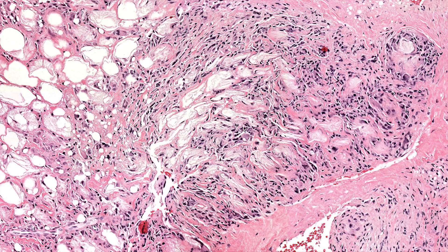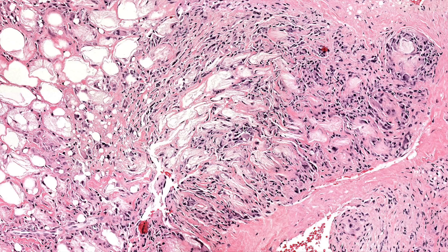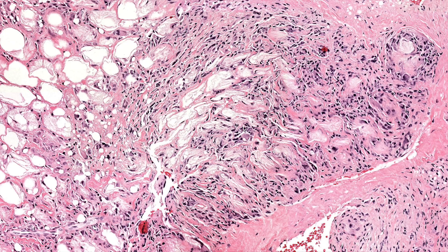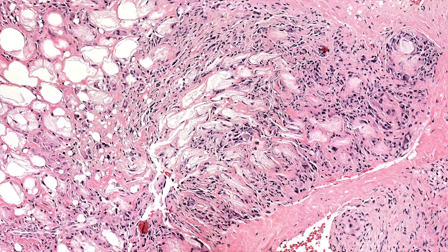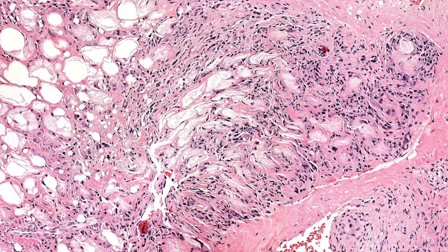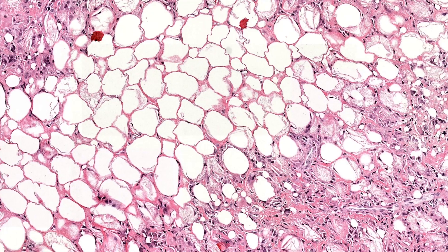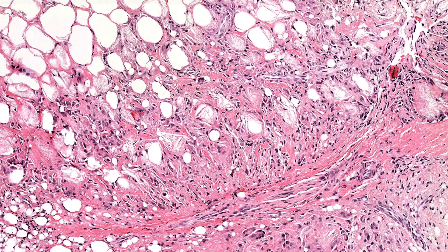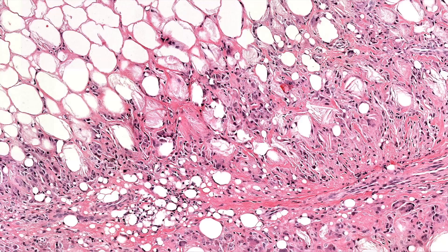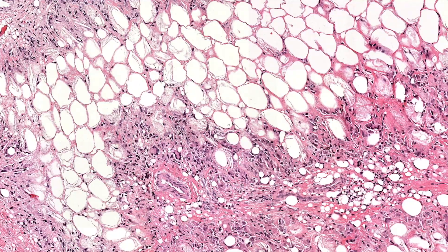Young babies have a higher concentration of saturated long-chain fatty acids in their triglycerides, so it tends to be easier for them to crystallize out at lower temperatures, making these spike-like crystalline structures. During processing, the lipid dissolves and just leaves behind the ghost outline of where the crystals were. That's my vague recollection — go look it up and hold me accountable.